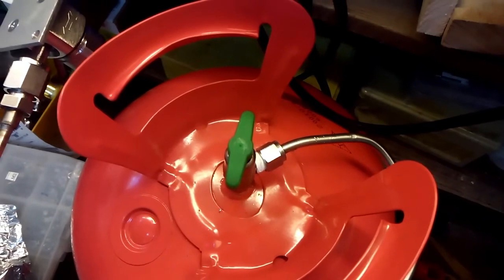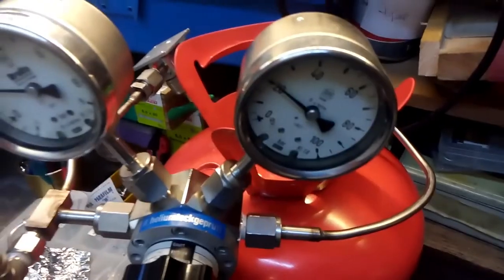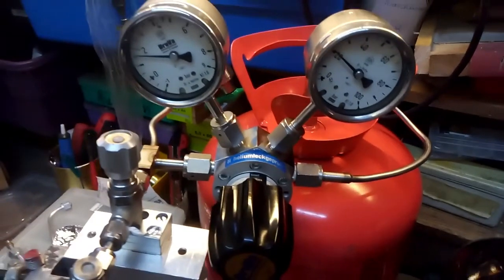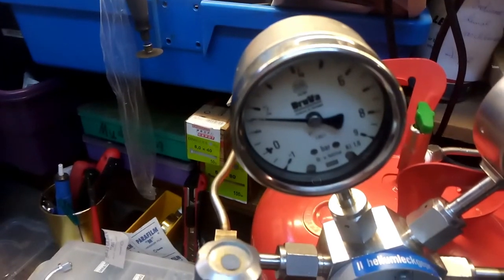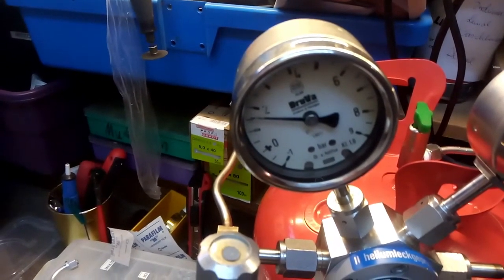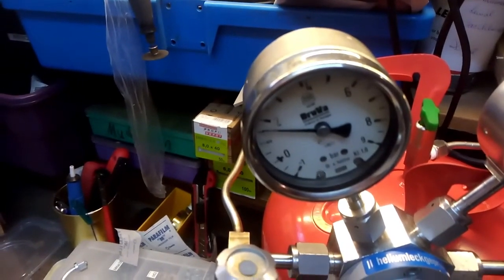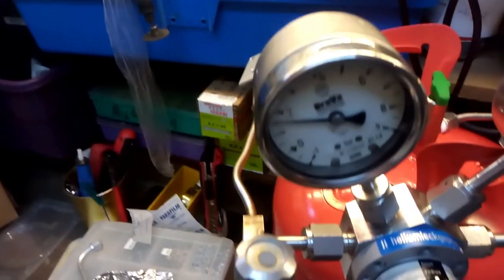Let's start with the carrier gas. The pressure is reduced to 1 bar. That's a bit too high for a capillary column, but I need this pressure so that the flow around the sensor makes an atmosphere around it, so there's no cross sensitivity to the air in the room. So there's just a helium atmosphere around the sensor.